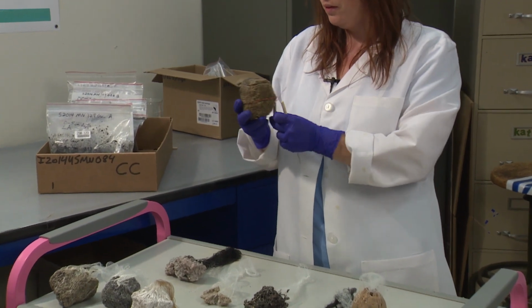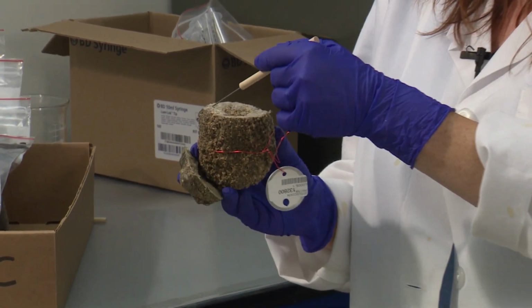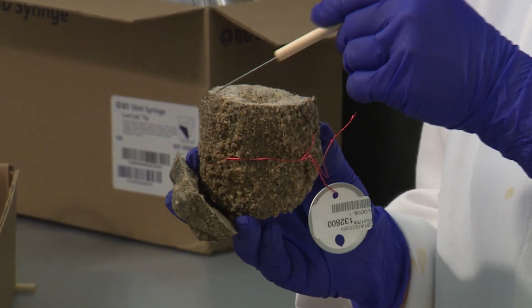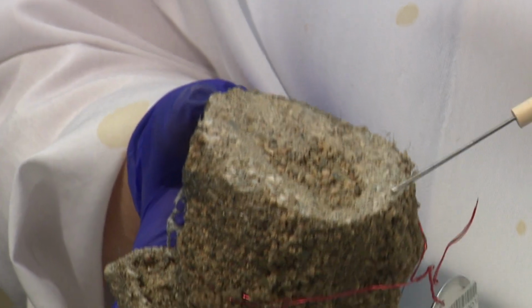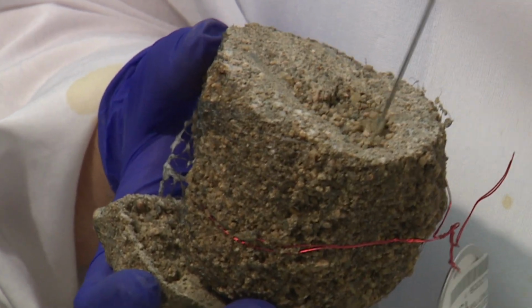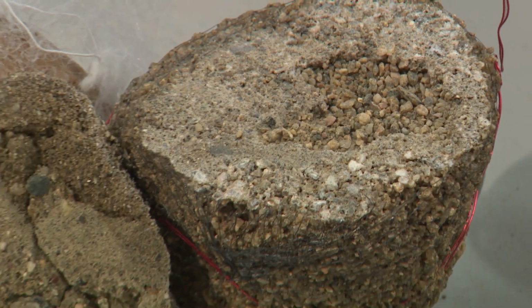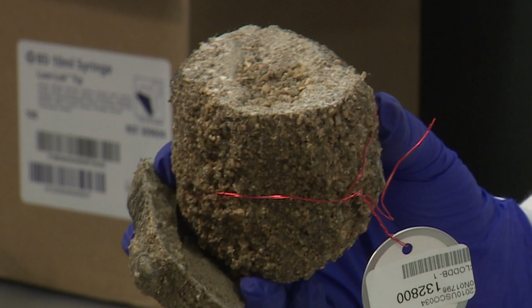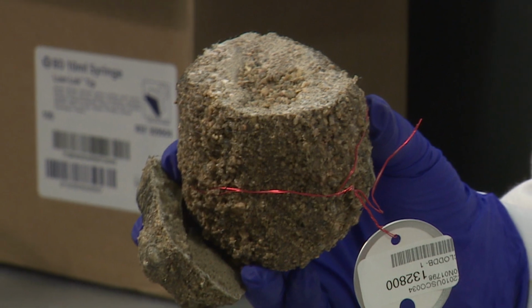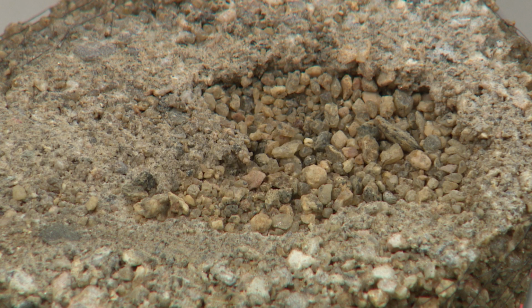Here's another clod that has a gravelly texture. It looks like a nice clod from the outside, but I have cut it open here to show you what happens when these loose texture clods are dipped in saran. As you can see, the saran has penetrated almost this entire clod, leaving like a solid outer casing and a very small portion of loose material in the center. These types of clods give us a misrepresentation of the bulk density, and for this kind of clod, compliant cavity would be a more suitable way to sample.